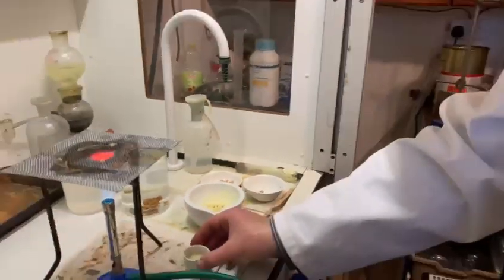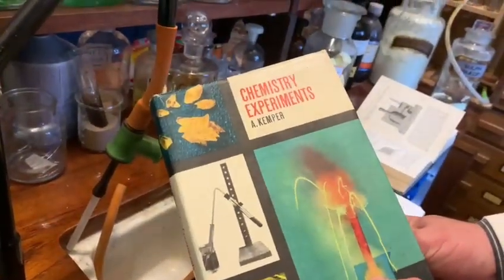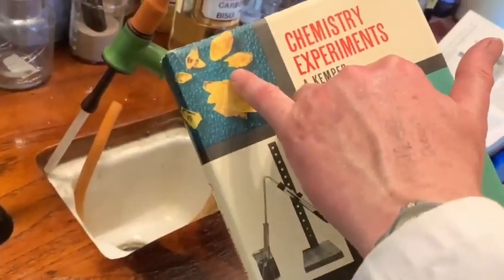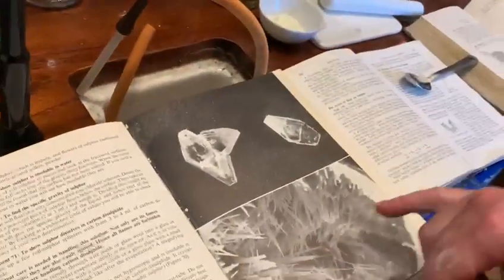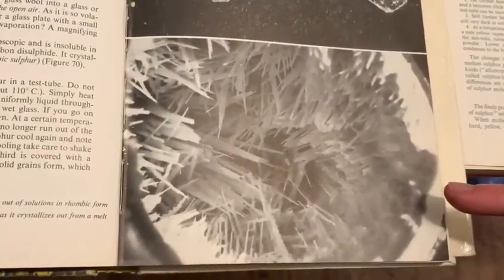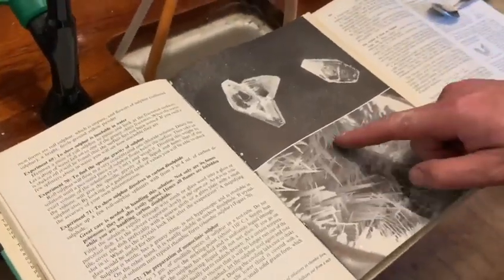A much better example is in one of these old chemistry books — one of my favorites, Chemistry Experiments by A. Kemper, a German. On the front he's got both forms of sulfur: rhombic sulfur and monoclinic sulfur. This is a good example of what the crystal looks like under a microscope. This is sulfur that's been heated up and slowly cooled down, and the center of the molten sulfur has been poured away, leaving these beautiful crystals of monoclinic sulfur.